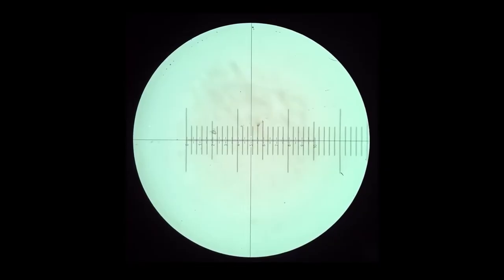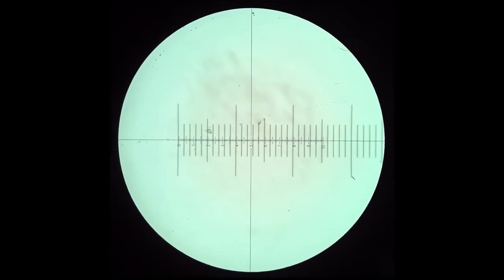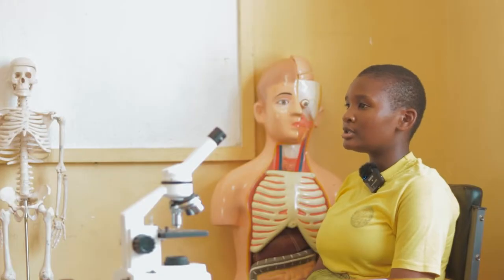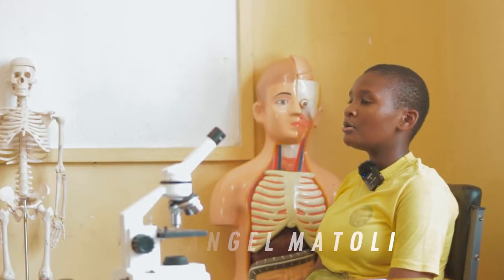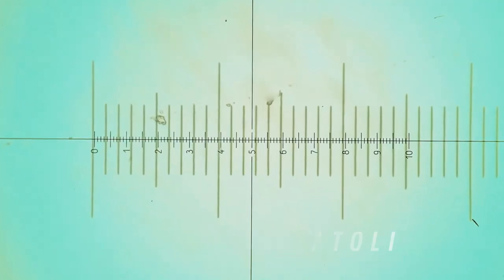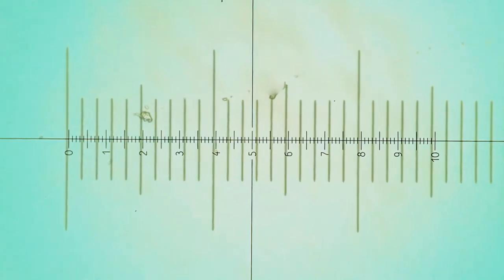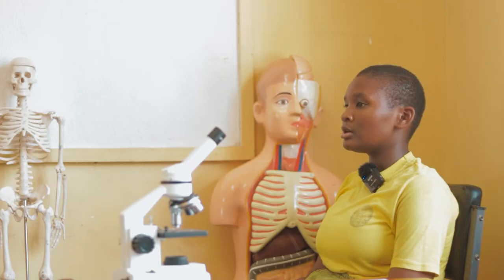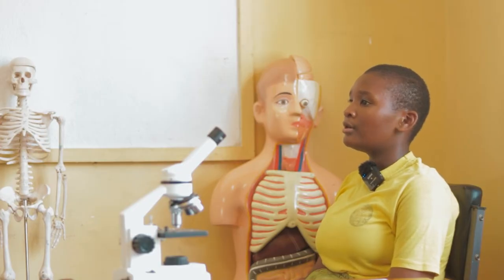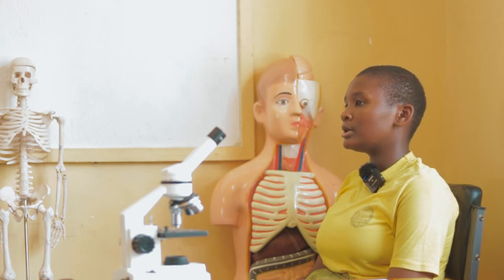Depending on the type of lens, it will magnify the specimen according to its focus. They can view very small specimens and distinguish their structural differences. For example, the view of an animal cell, plant cell, and other microscopic materials.